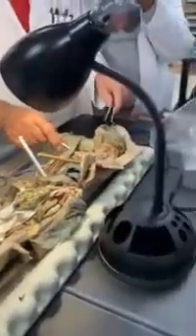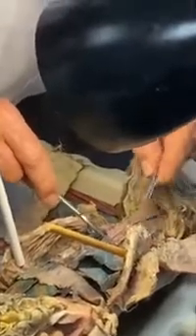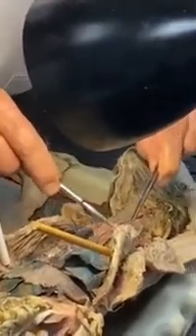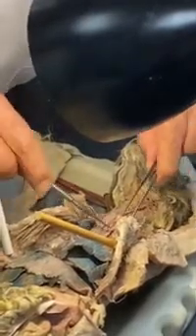Okay, let's do the left side, because left side was a little bit more cooperative when it came to that long thoracic and ventral thoracic. So there's your subclavian, and then IVCT, right? Internal mammary. There it is. This one broke, but that was attached to right there. V, vertebral. There it is, going down deep in here.